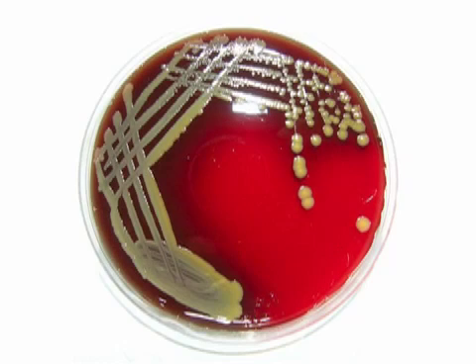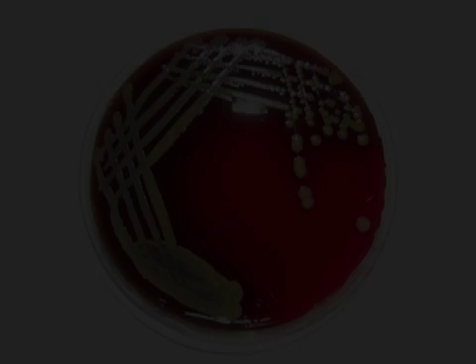After incubating, single colonies should be present on the plate.